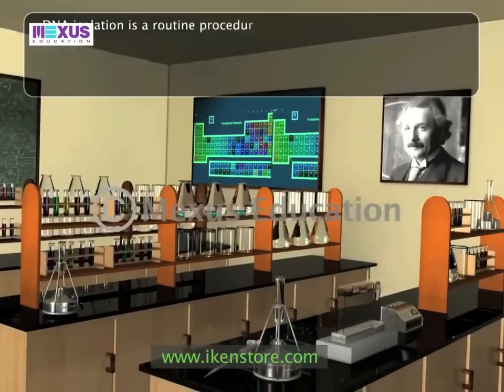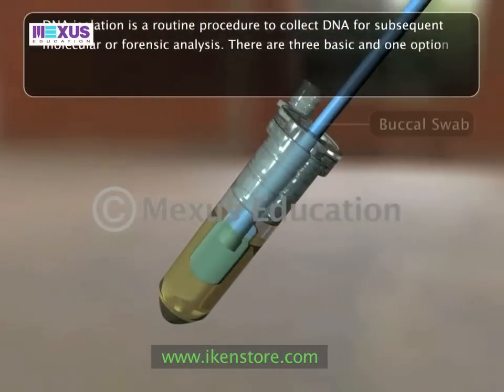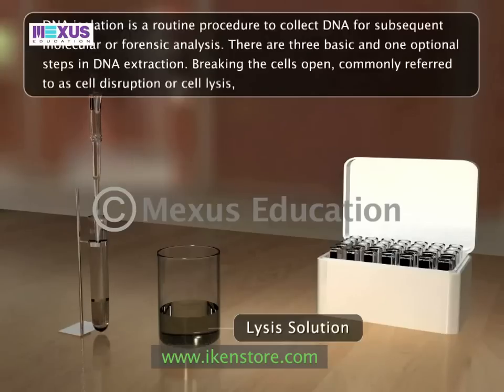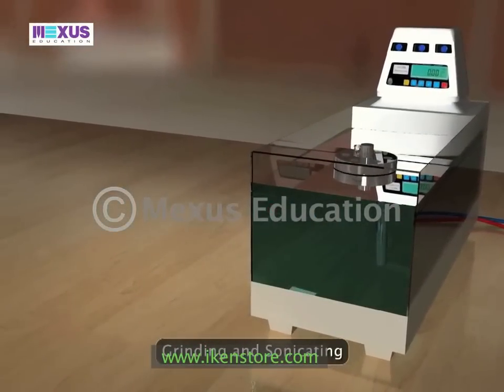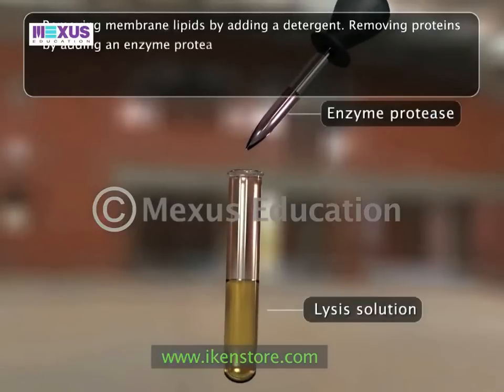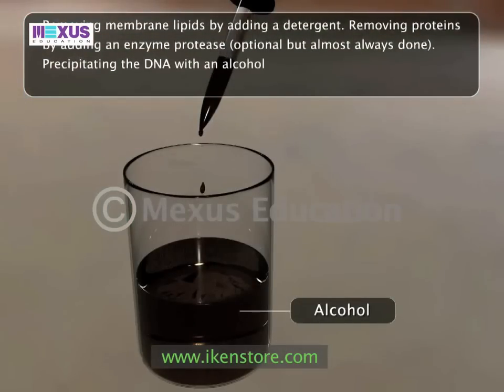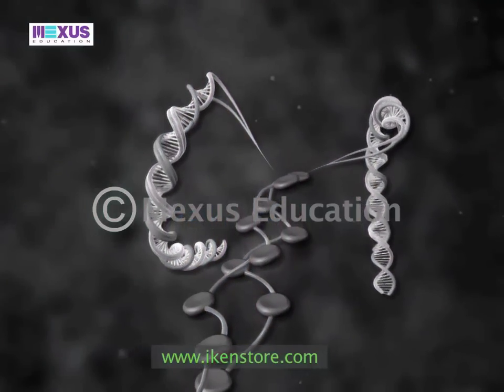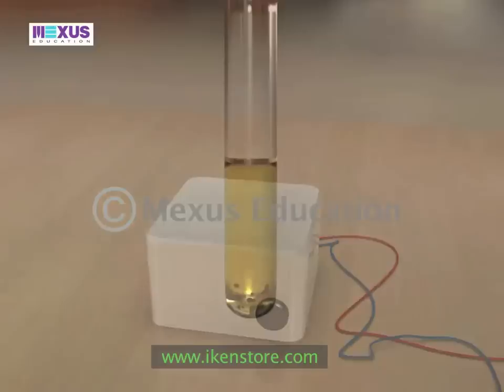DNA isolation is a routine procedure to collect DNA for subsequent molecular or forensic analysis. There are three basic steps and one optional step in DNA extraction: breaking the cells open through cell disruption or cell lysis to expose the DNA; removing membrane lipids by adding a detergent; removing proteins by adding an enzyme protease (optional but almost always done); and precipitating the DNA with an alcohol — usually ice-cold ethanol or isopropanol — since DNA is insoluble in these alcohols, it aggregates and forms a pellet upon centrifugation, also removing alcohol-soluble salts.